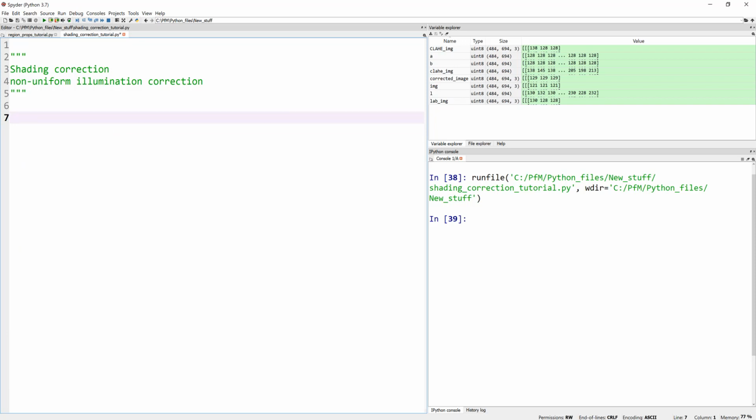What do we mean by rolling ball background? Well, the background value is determined at every pixel by averaging over a very large ball background around the pixel. So let's say my central pixel is somewhere here, and then I can define, okay, my rolling ball has a radius of 30. It actually averages all the pixels, and then it gets the background and subtracts the background, and creates this. It removes, in other words, large spatial variations in background intensities when you perform this operation. The radius, of course, should be set according to your input image, right? It cannot be too small.